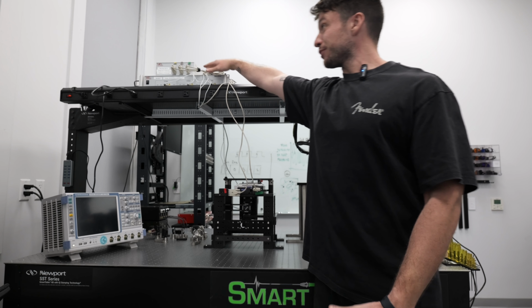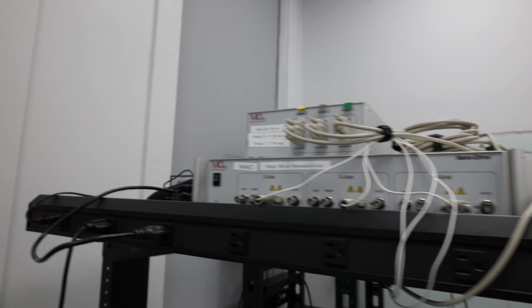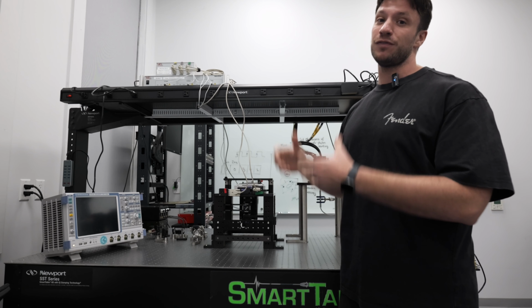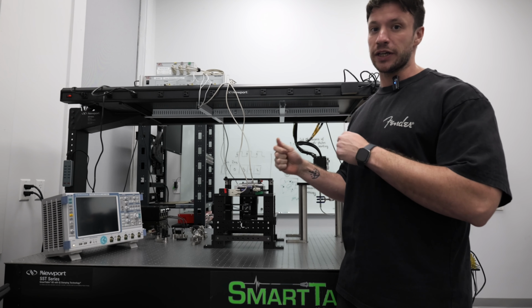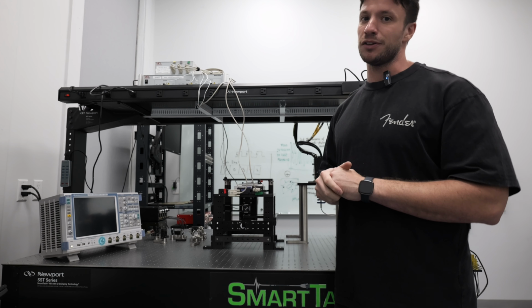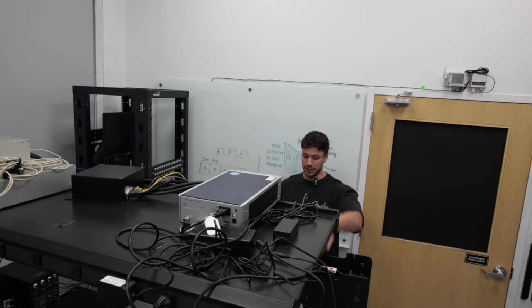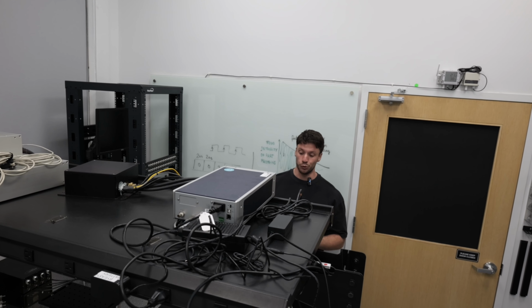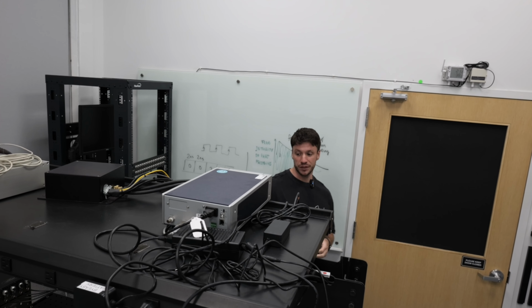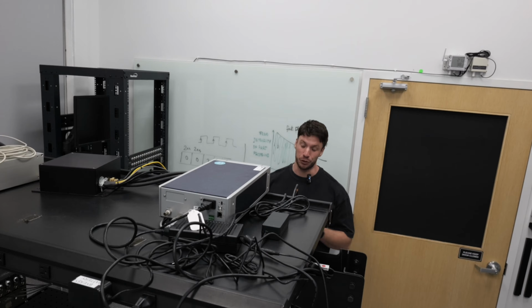These are 2 controllers for the sample stage. One that controls coarse motion and one that controls fine motion, to actually look at different parts of the samples, focus in different planes, and so on. This is a sensor for magnetic field, and right now it's set up to do a calibration of this big magnet so that I'm able to control it via Python code.